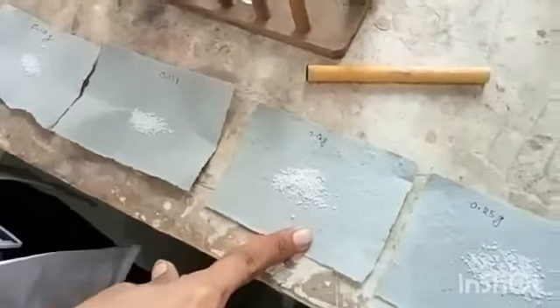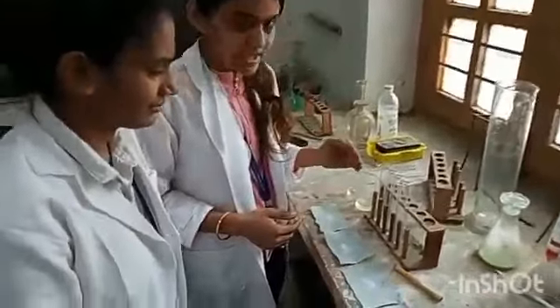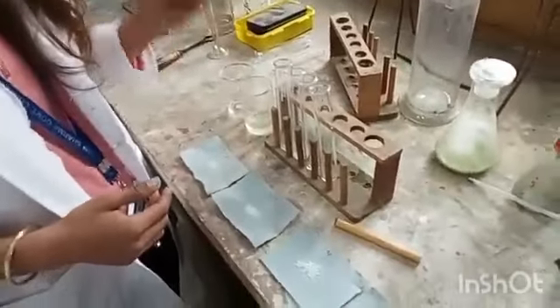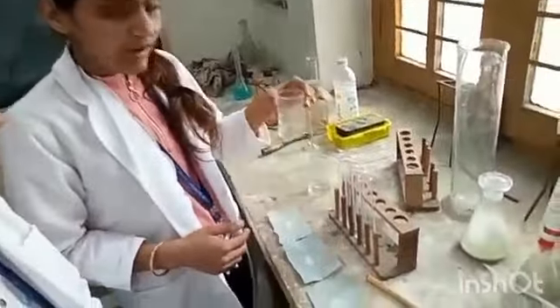We have taken 0.1 gram, 0.15 gram, 0.2 gram, and 0.25 gram of benzoic acid. We have taken 4 different test tubes which we named A, B, C, and D. In all these 4 test tubes, we will take the same amount of water, which will be 20 mL.